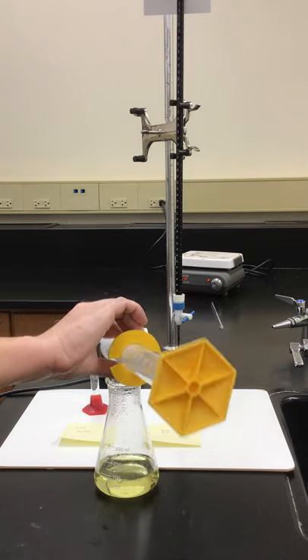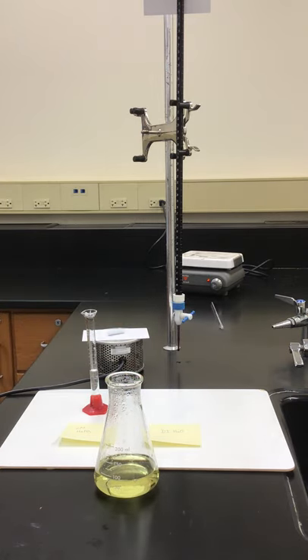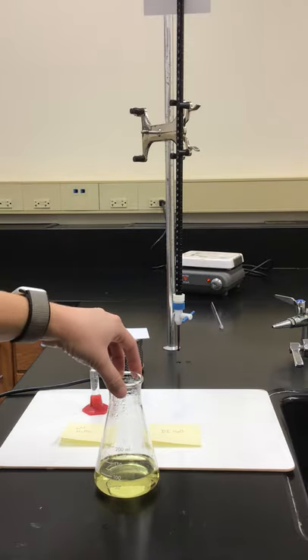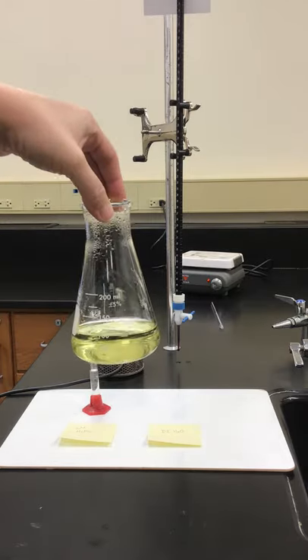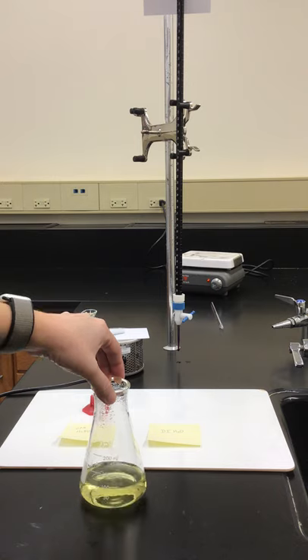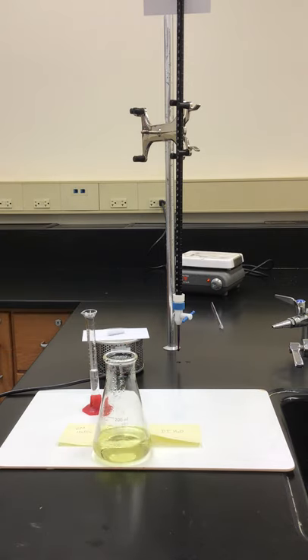We're going to add some phosphoric acid. The phosphoric acid is to decolorize our iron ion. The iron ion is a little bit yellowish, as you can see there from that solution. That would mess up the results of our titration. It would be difficult to see that light pink ion from the permanganate changing its oxidation state from a plus seven to a plus two.